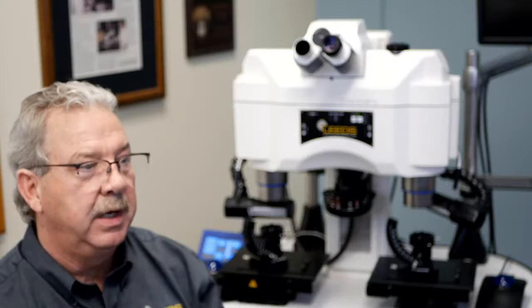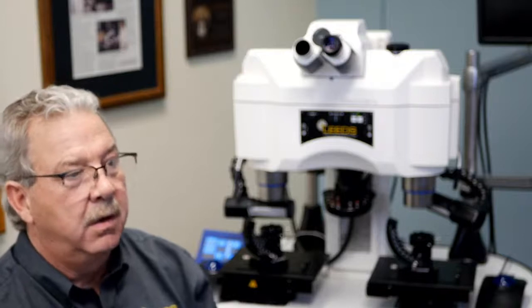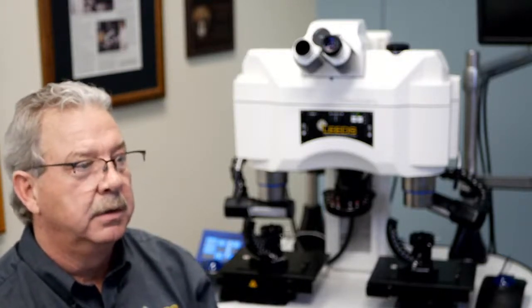Even the difference between them is notable: the area of a 23mm field of view eyepiece is over 9% larger than a 22mm. Okay? Leeds really offers only 2 eyepieces. We don't see any reason for quoting an 18 or a 20mm field of view eyepiece. All of our LCF and LCT products are offered with a 22mm field of view, and the Discovery and Trace Z comparison microscopes are all offered with a 23mm field of view.